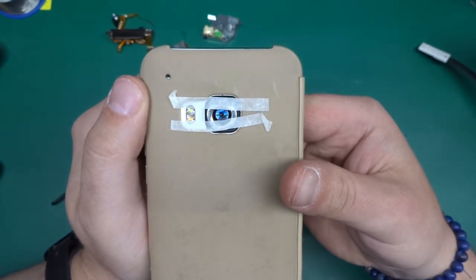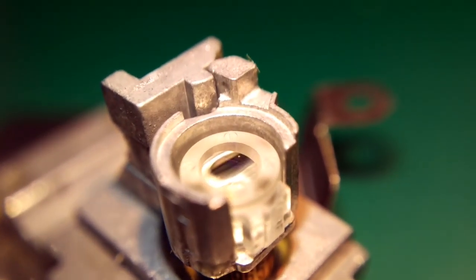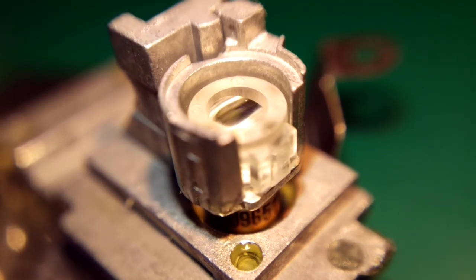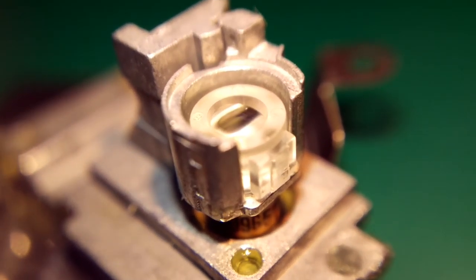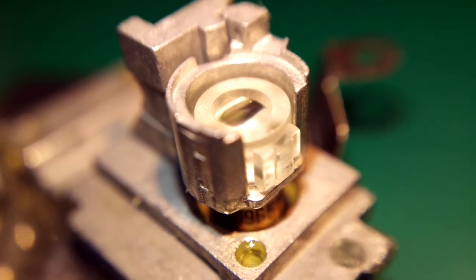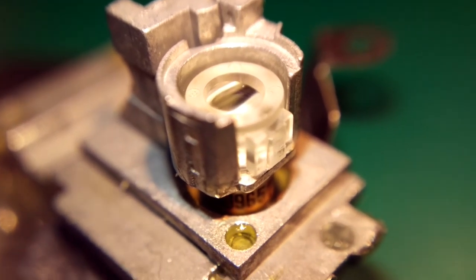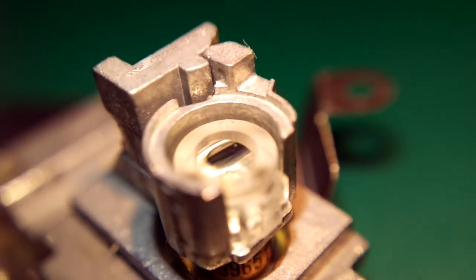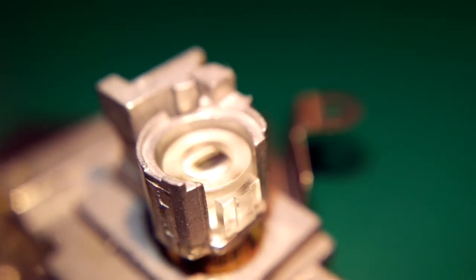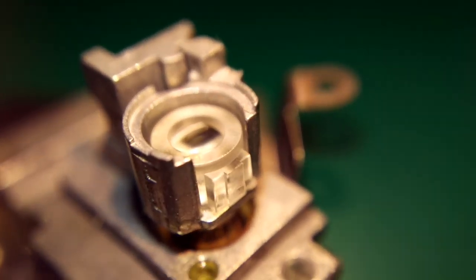So let's put it into action. There we go. So that's one of the laser diode assemblies, and you can see the image quality is really good. Now this requires quite a lot of light, so I'm shining on top of it with just a power bank with some LED light stuck onto it. But you can see the magnification is quite high, and the focal length of the setup, let me just have a look. It's roughly about 3 centimeters of working distance, so it's reasonable if you want to look at something.